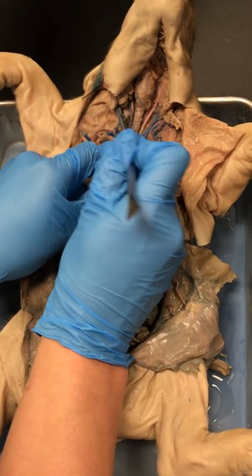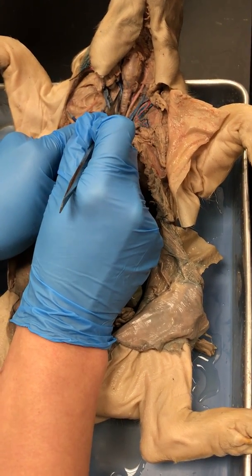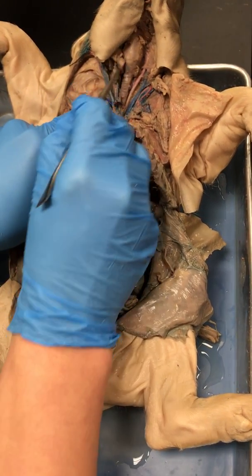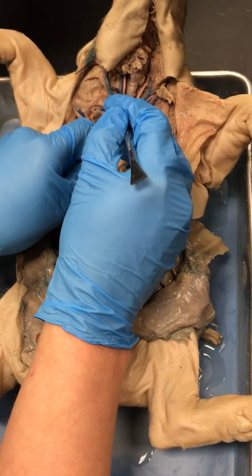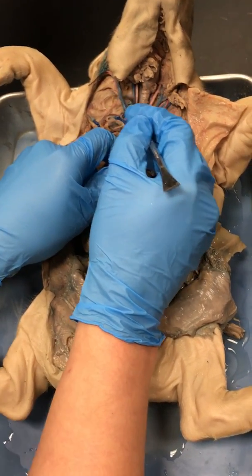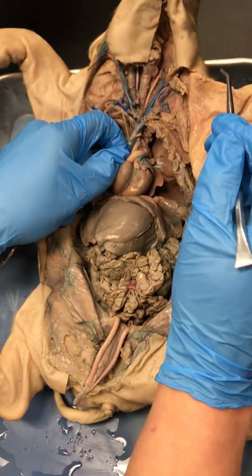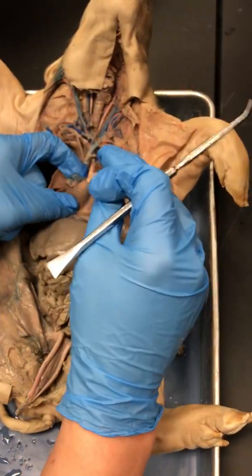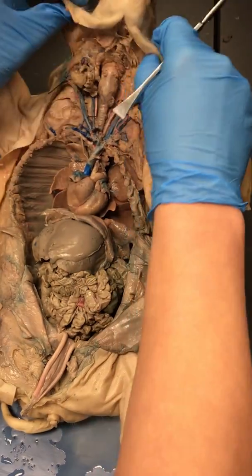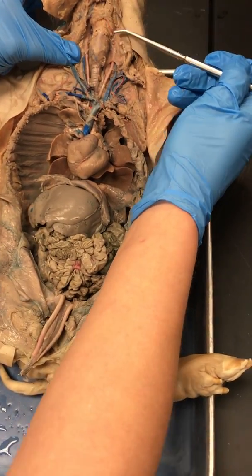Sitting juxtaposed to my carotid arteries is going to be my internal jugular. And then if I come out a little bit, this is on the outside of the body. If I have an internal, I probably have a what, guys? External. Fantastic. So who do you think this is? External jugular. Great. All right. That is the main parts of the cardiovascular system that you need to know. Now, let's go on into the respiratory tract.